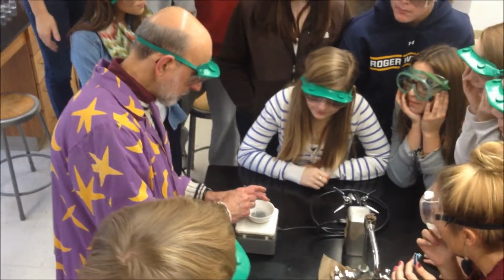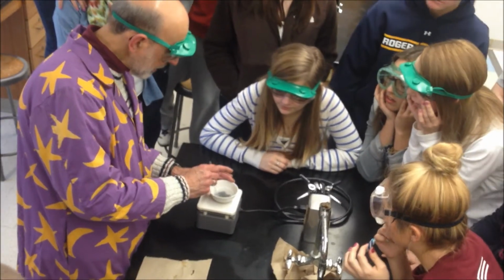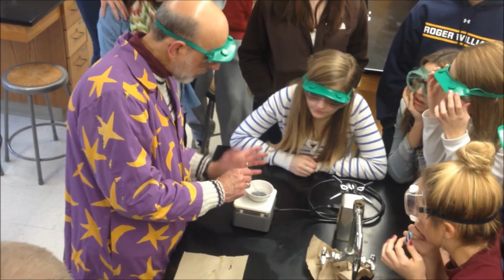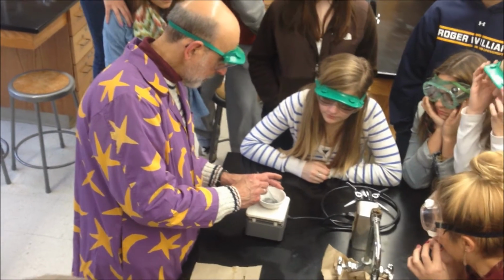Does it eat away the copper? Well, it's not. Oh, you're zinc plating it. It's actually not taking away the copper, it's adding in zinc. So these are going to be zinc coated. And the reason I said, you know, if you have shiny pennies, it just looks better if they're shiny. But there's actually more to it than this.